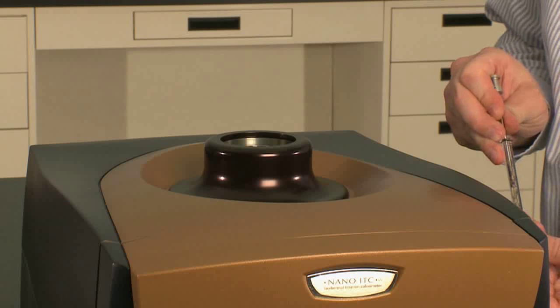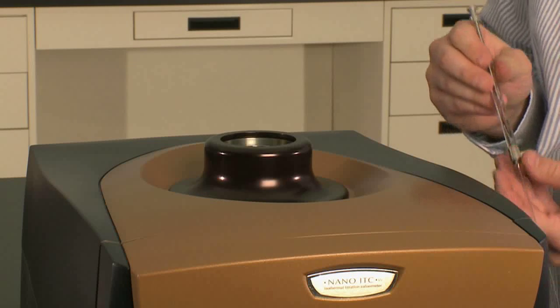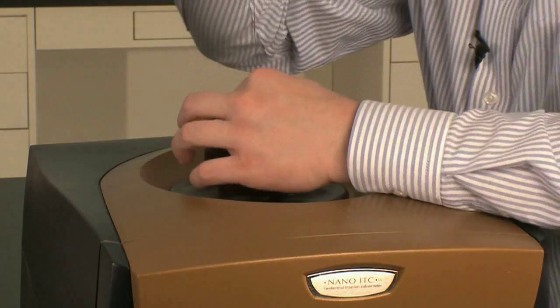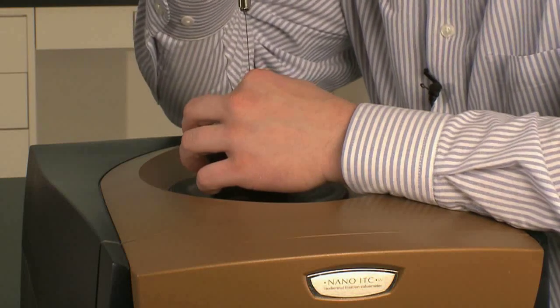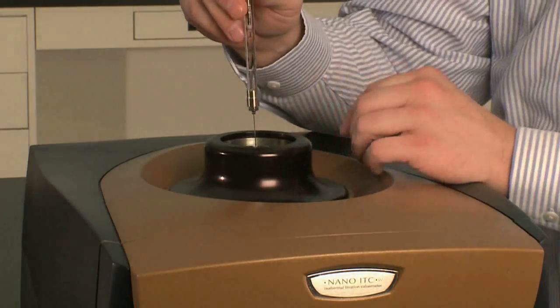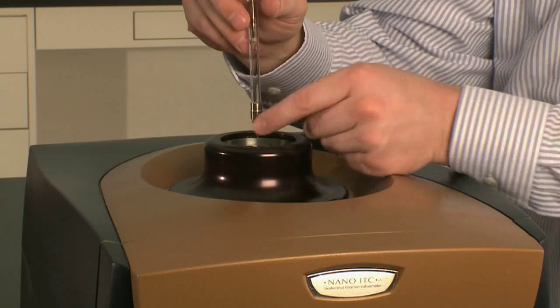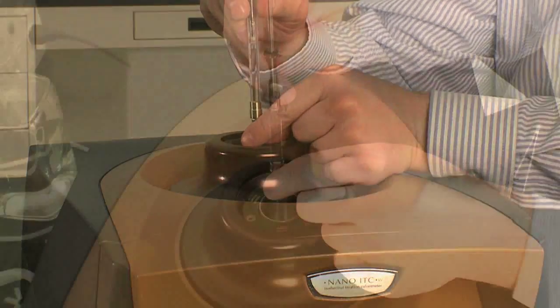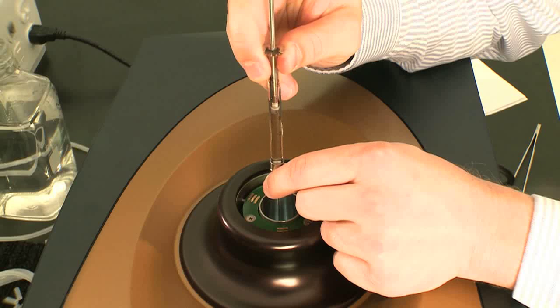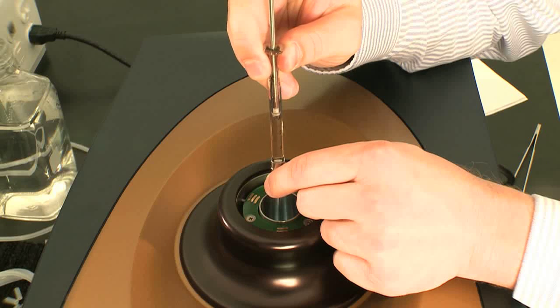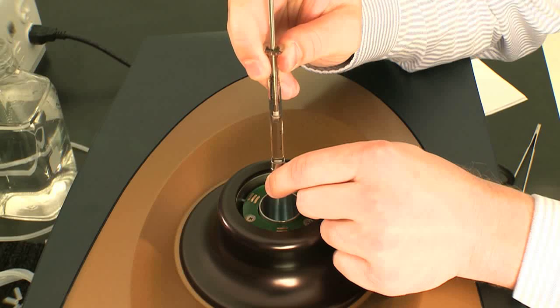I'm just going to load with water here for example, but I'm going to load with 300 microliters of water. I slowly lower the needle down into the cell until I just hit the bottom, slightly lift, and again just slowly inject the solution into the cell.